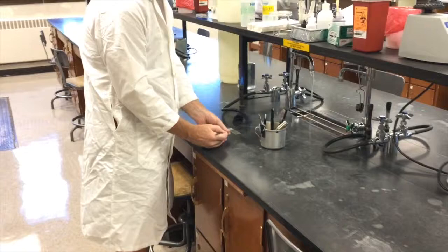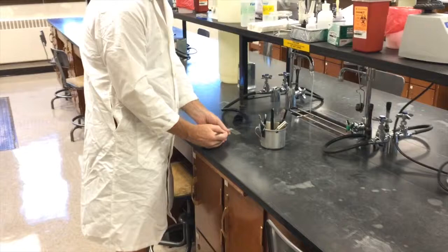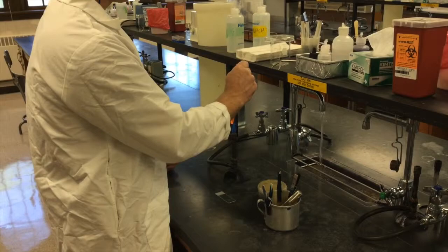Place that on the slide. Now if you shake like me, you might want to brace your loop. Now this is just water. I'm not going to worry about aerosols. I'm going to stick it right into the flame and sterilize it.